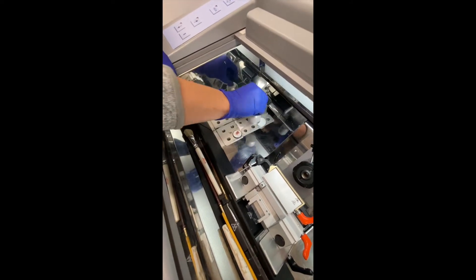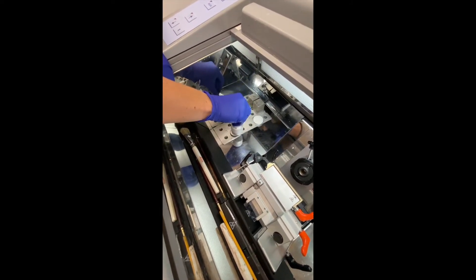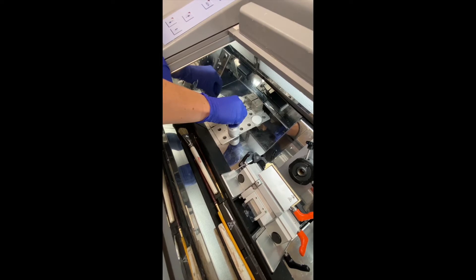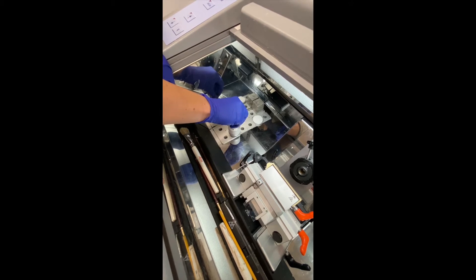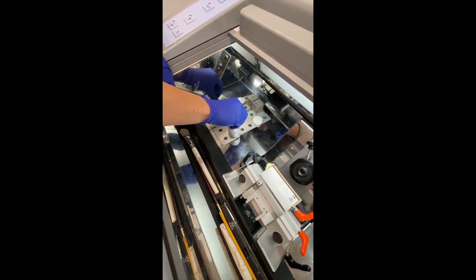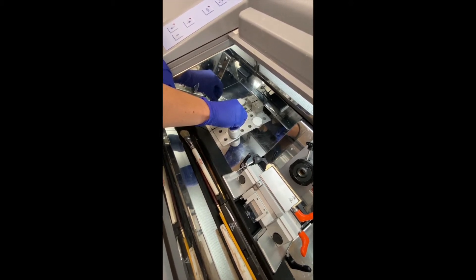The heat sink, when placed on top of your specimen, serves two purposes. The first is to cool the specimen more quickly, and the second is to flatten the specimen so that when cutting, everything is in the same plane.